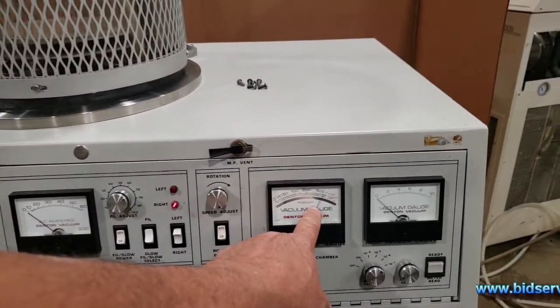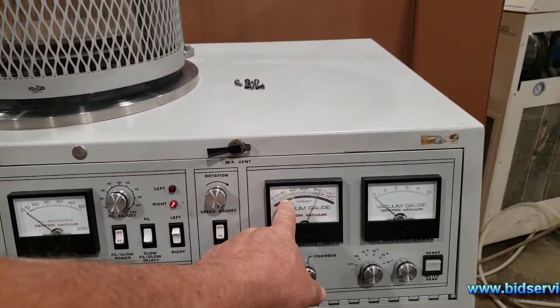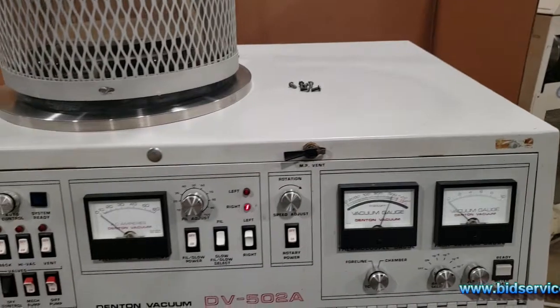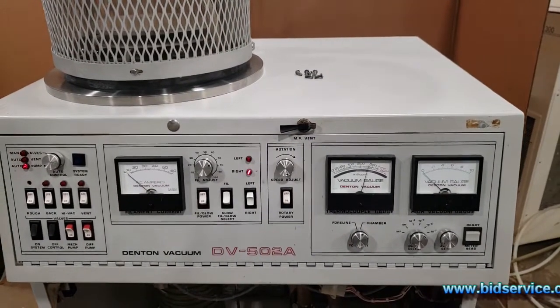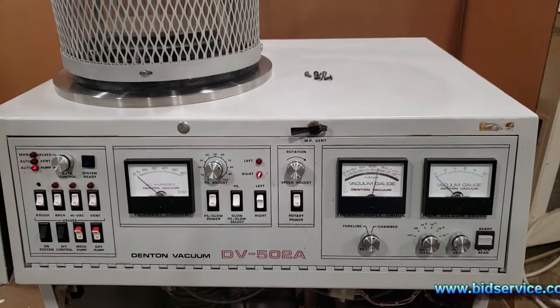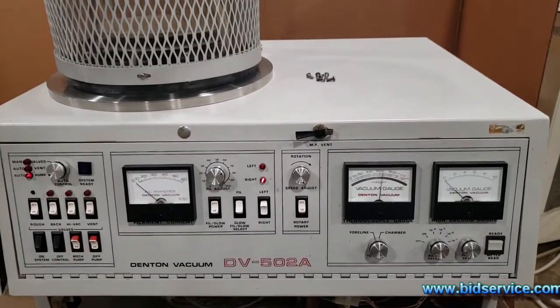And as you can see, your vacuum gauge is coming down right now. Once it gets somewhere around here between 20 and 50 millitorr, you'll hear it go through a series of valves and put it under HiVac without dumping the system.